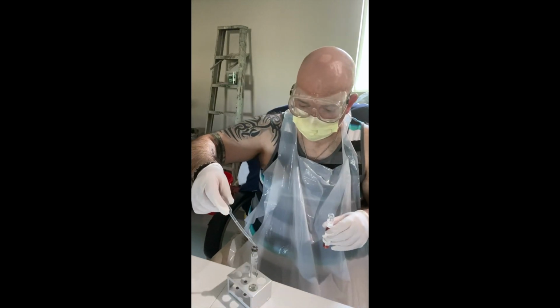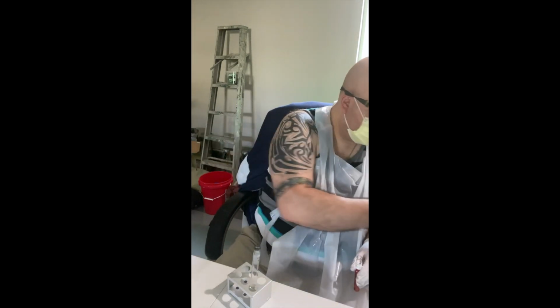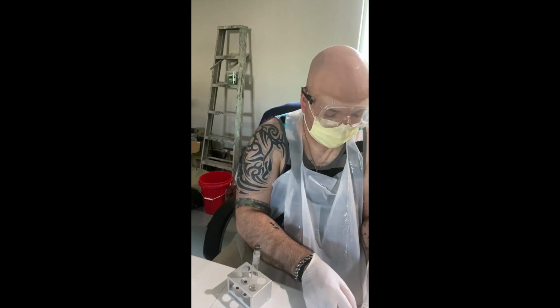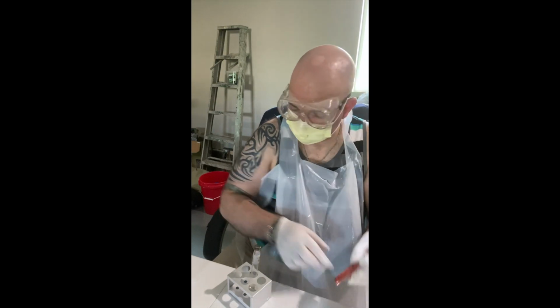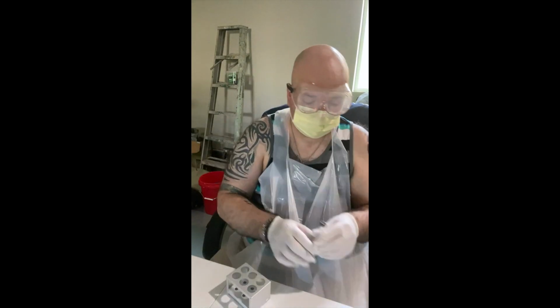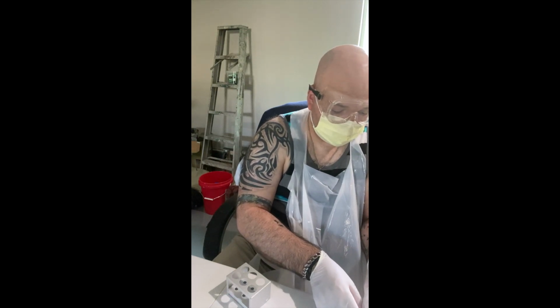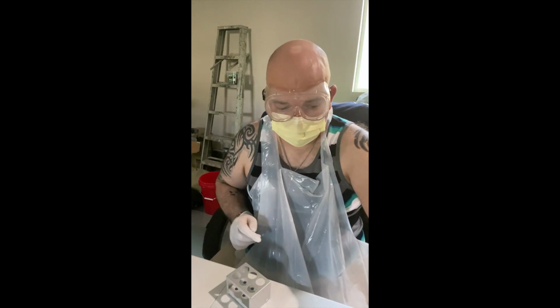The remaining culture is going to go back into the tube. Okay, this is going into bleach. Flame this again. Okay. Lid on. I'm going to flame my culture tube here to sterilize. Okay. Lid on, set it aside.